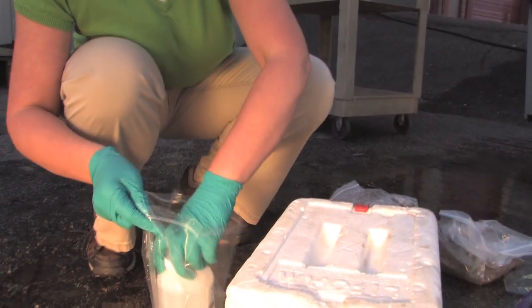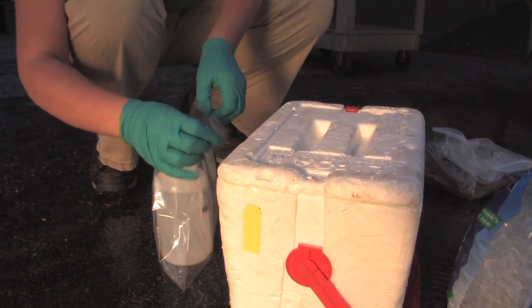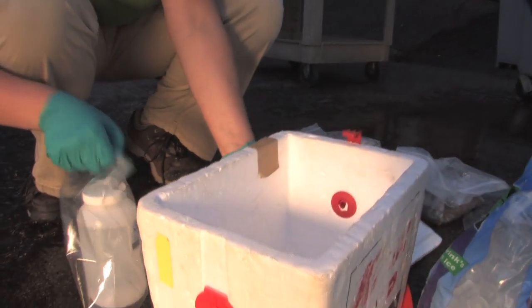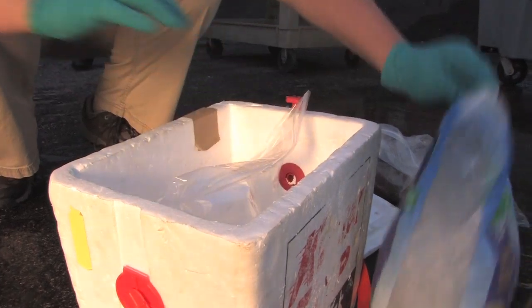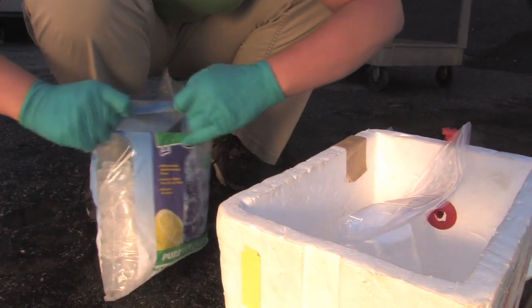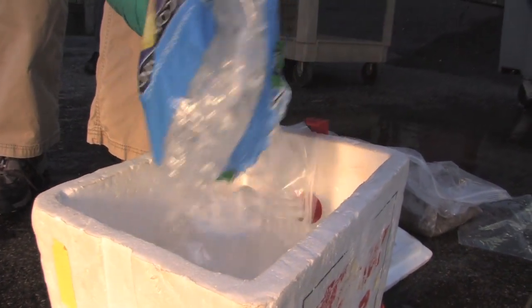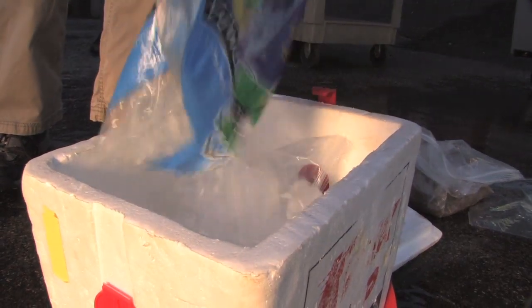Place the samples inside a resealable plastic bag and place the bottles into the cooler. Prepare the cooler according to lab instructions for pickup or shipment to the lab. Often, labs require that the samples be packed in ice to help preserve the sample.